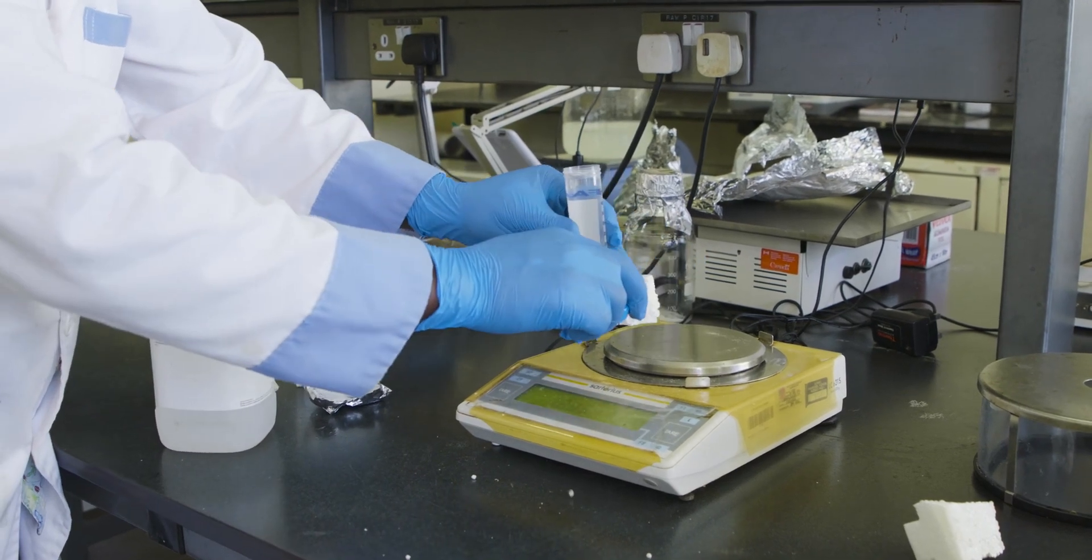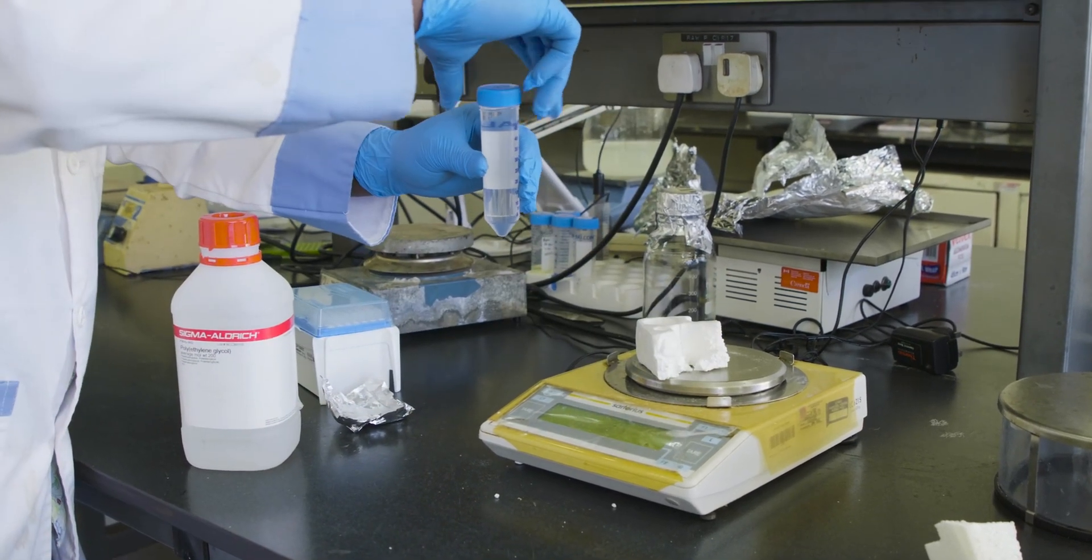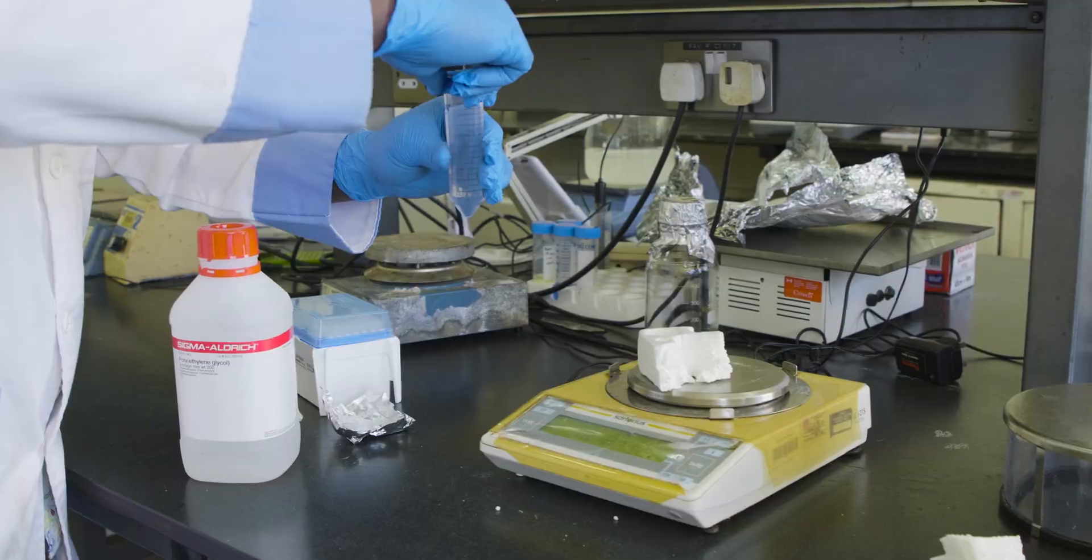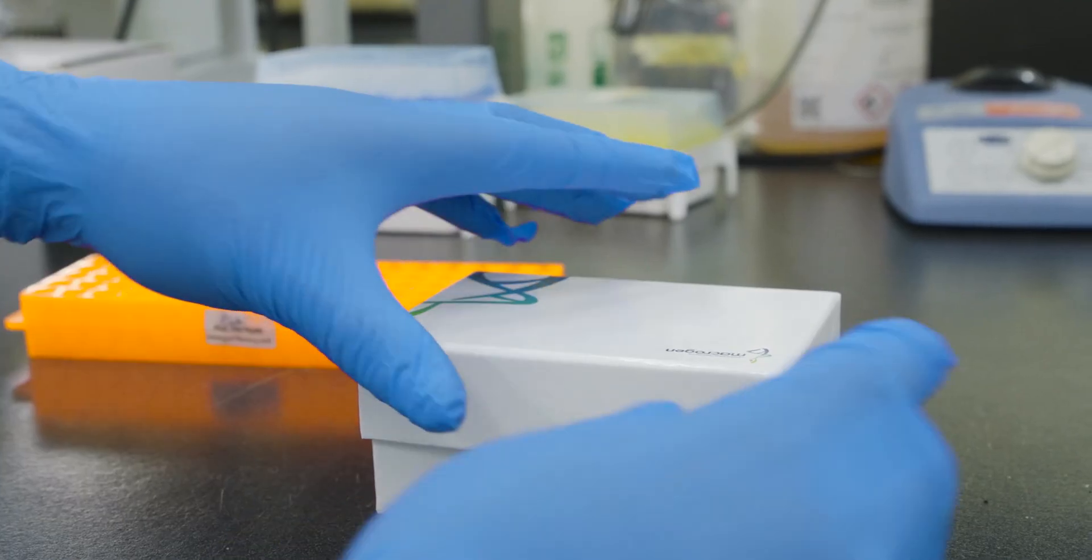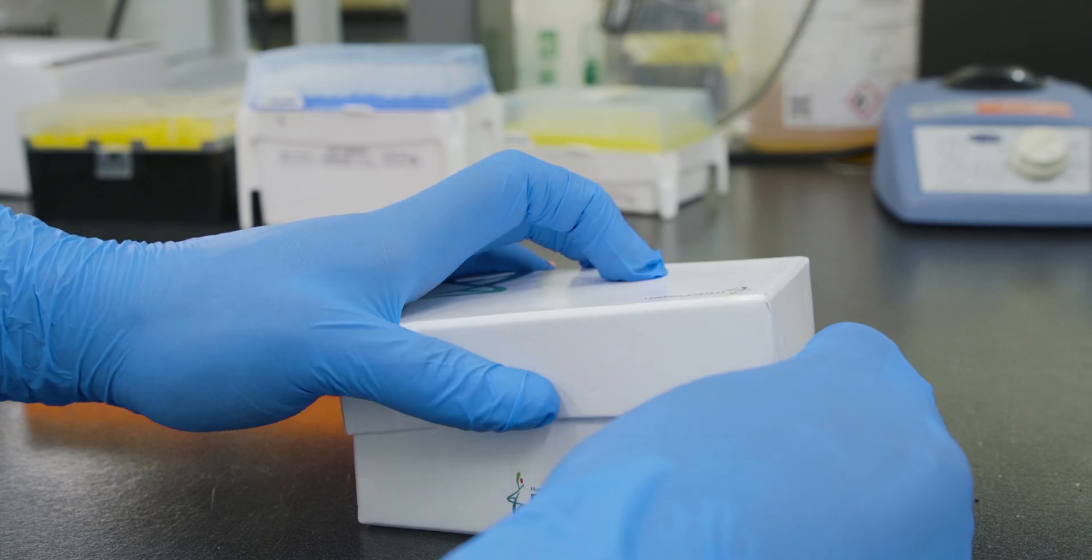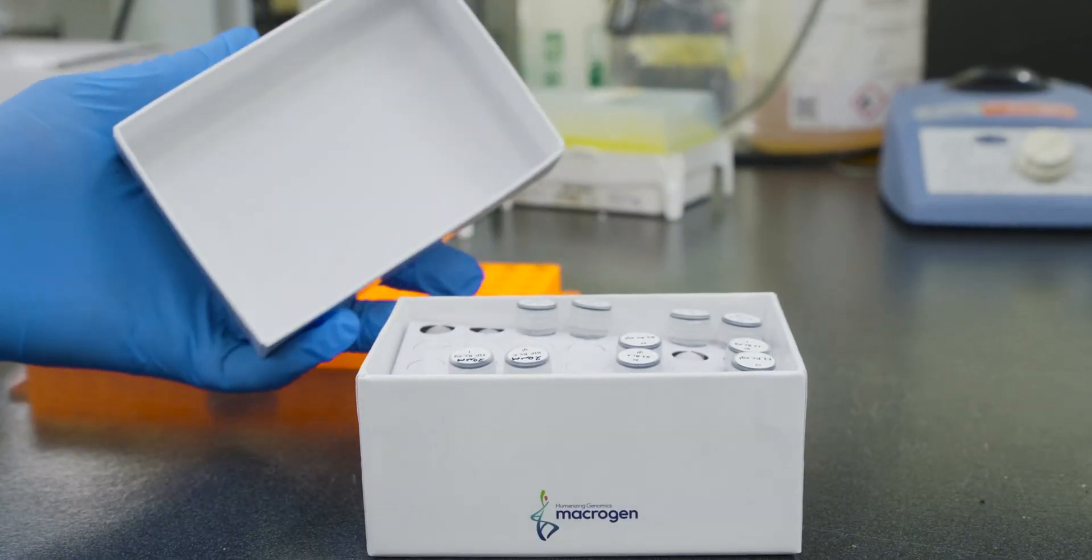It's important to prepare all your materials prior to going to the field for on-site detection. Charge the batteries of your lamp assay machine. Double check to see if you have all the primers and instruments needed to conduct the lamp assay.